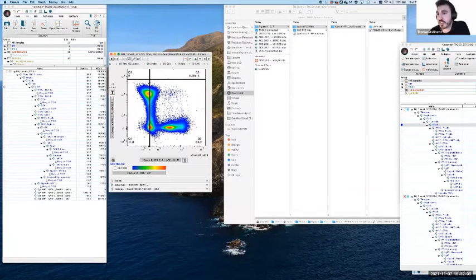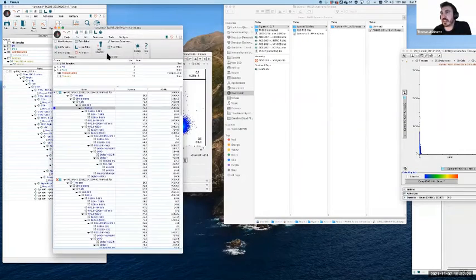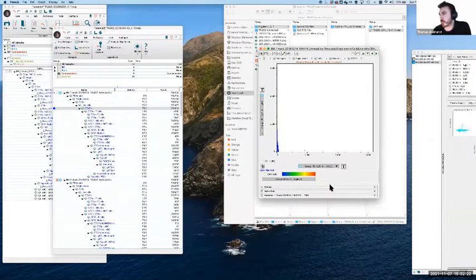That is something which is, I think, the first step we teach new students that come through the lab, for instance, and it's very helpful in doing this sort of stuff. So the very last thing I just wanted to show briefly is that in unmixing for spectral data, I'm just going to switch that back.